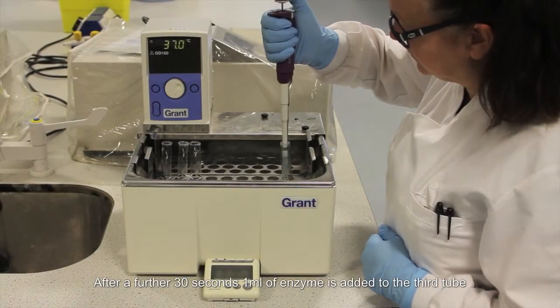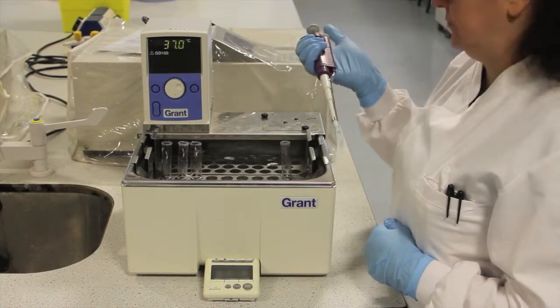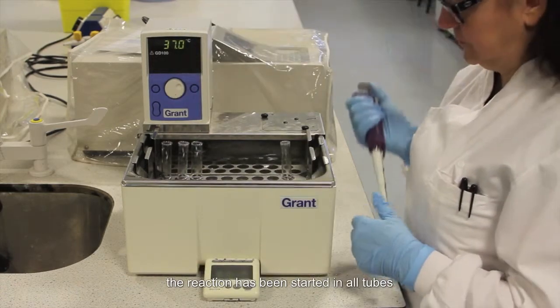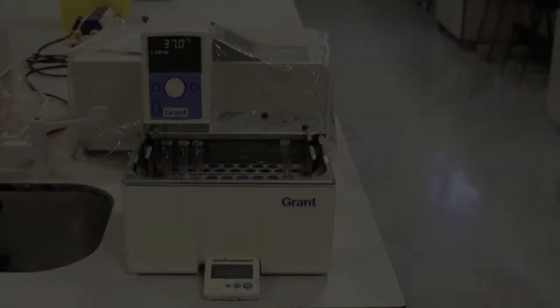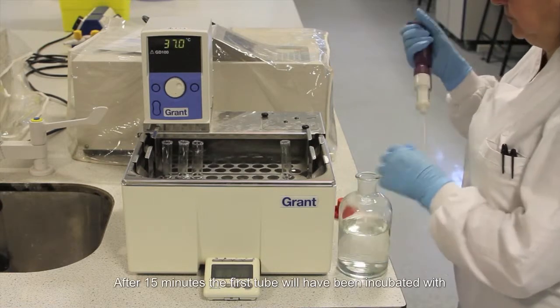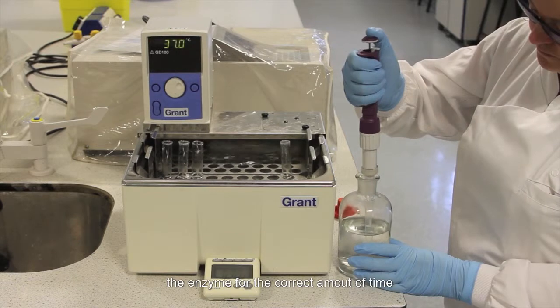After a further 30 seconds, 1 milliliter of enzyme is added to the third tube. This process can be continued at 30-second intervals until the reaction has been started in all tubes. After 15 minutes, the first tube will have been incubated with the enzyme for the correct amount of time.